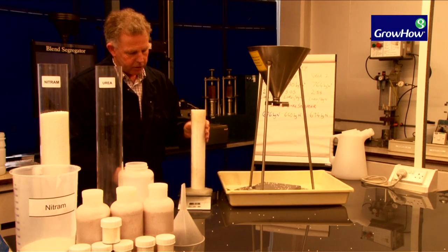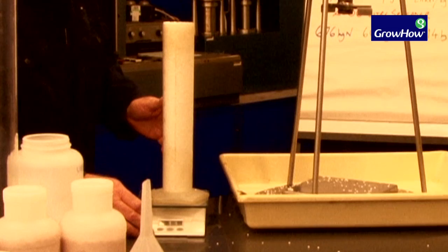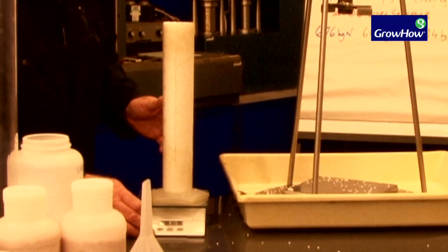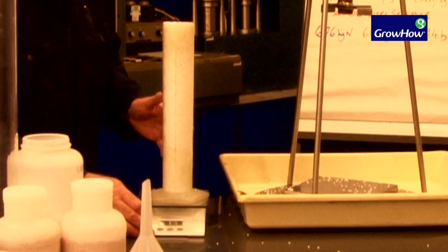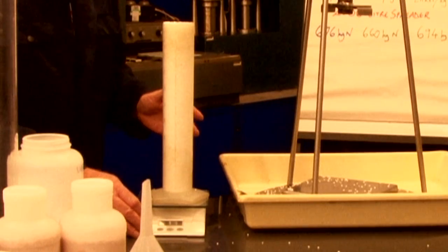There I have my litre of the first urea sample, and the bulk density comes out at 732 kilograms per cubic metre.